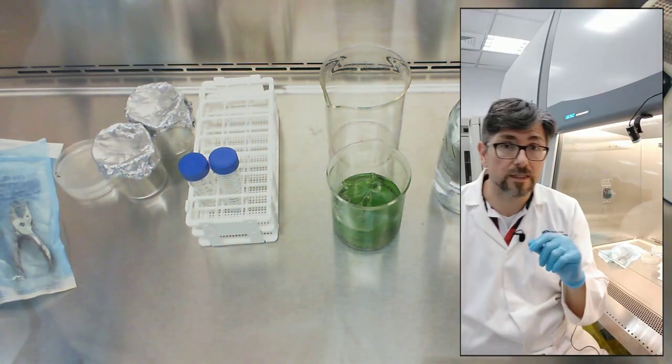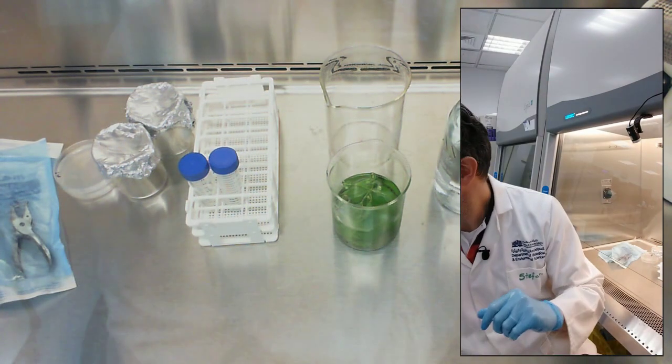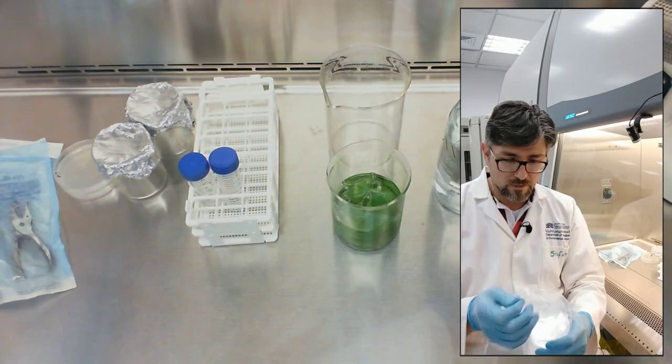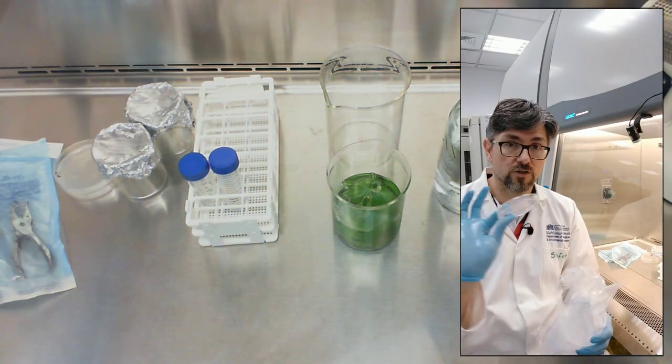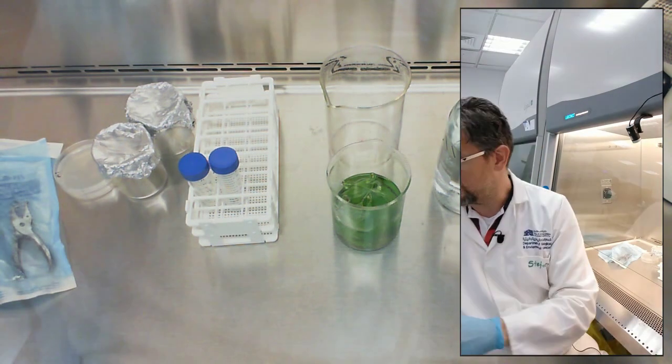I need a petri dish, a clean petri plate. These are great for helping to sort things and keeping things clean.